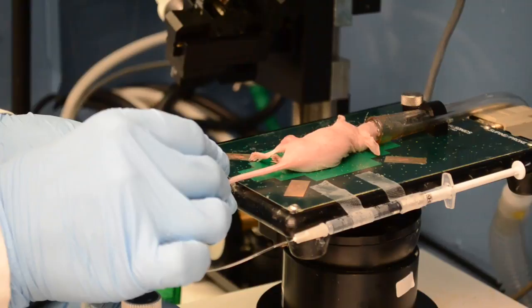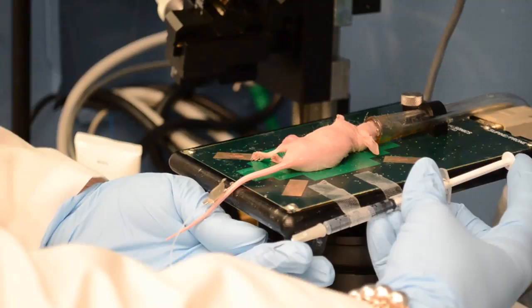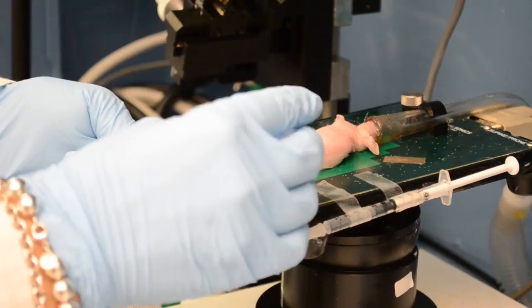Ensure access by slowly injecting 10 microliters of saline. If there is no resistance and you can observe the flow travelling through the vein, the injection has been successful.